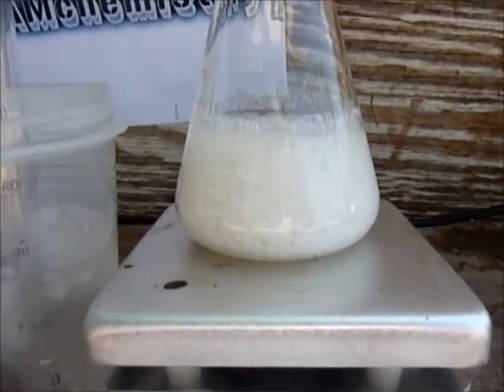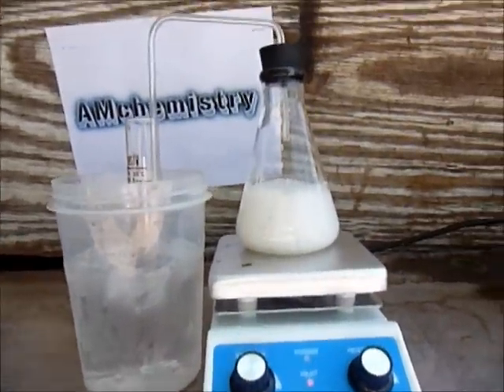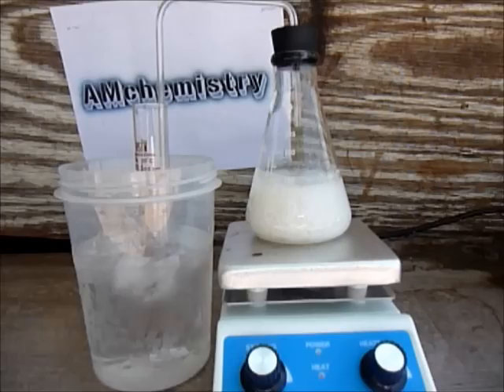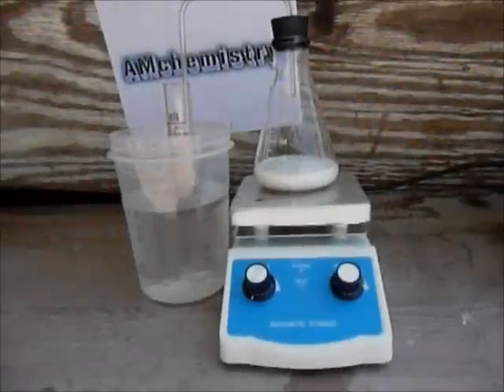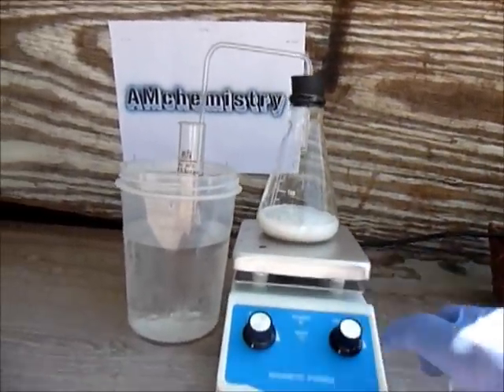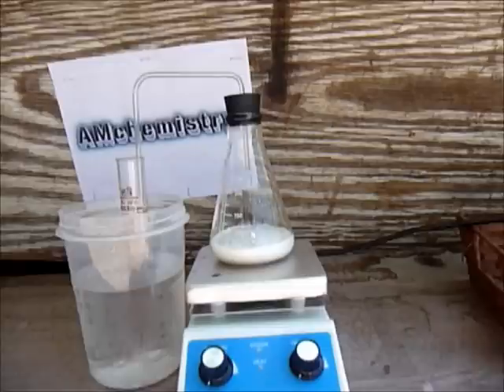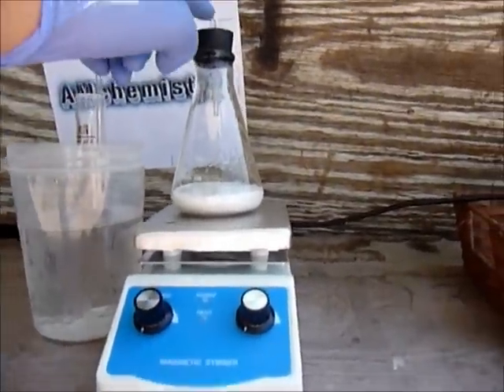Now it's bubbling like crazy and we're seeing a lot of bubbles, so it's almost finished. I'll show you when I'm fully complete 100%. So I'm done already. The next thing is to turn off the heat, and when you see it start refluxing, take this off.